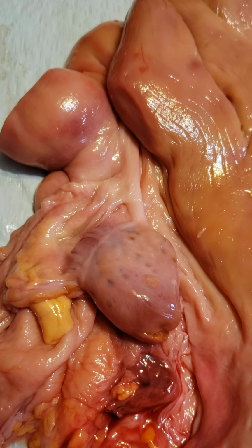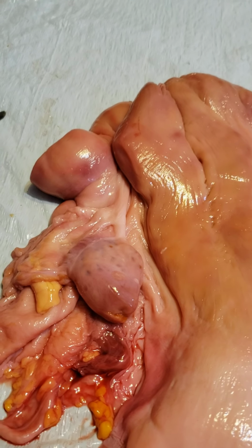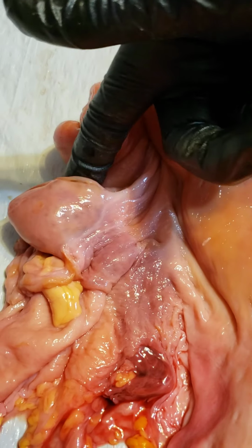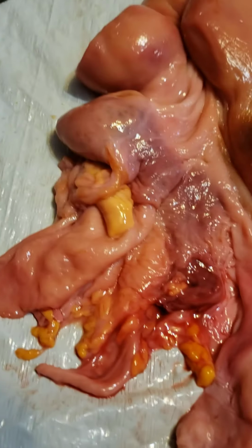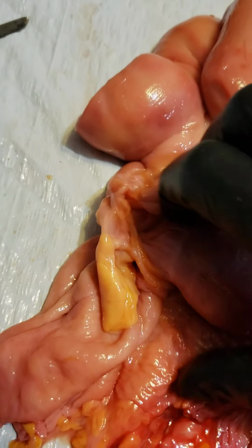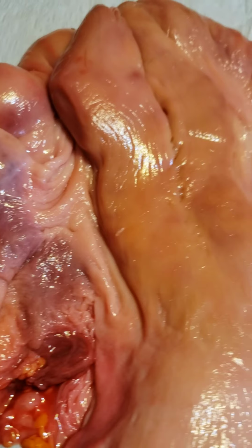After the Graafian follicle bursts and releases the egg, it turns into a corpus luteum, which is a yellow body that produces progesterone using the granulosa and theca cells. Now, I'm looking at my ovaries and I don't really see any yellow bodies on the outside of either one of them. So that indicates to me that this reproductive tract did not have a Graafian follicle that has recently burst to create a corpus luteum.